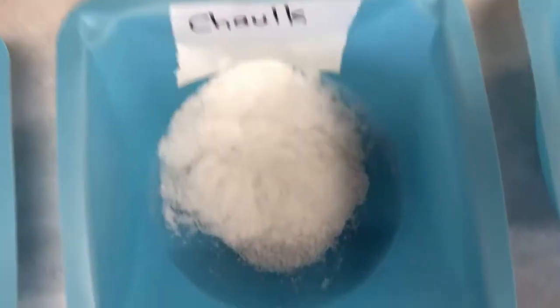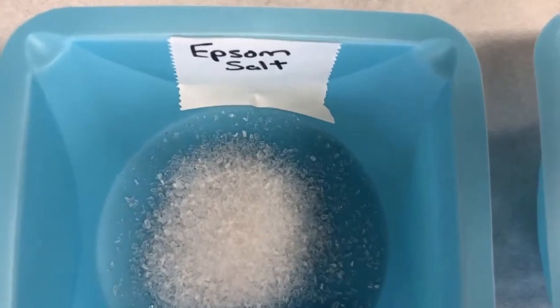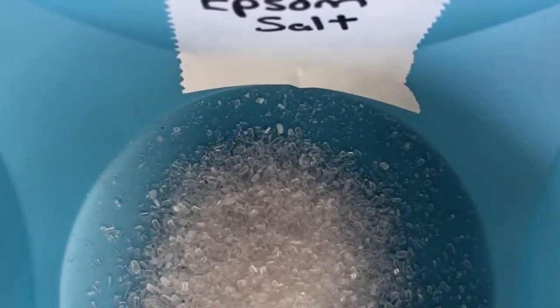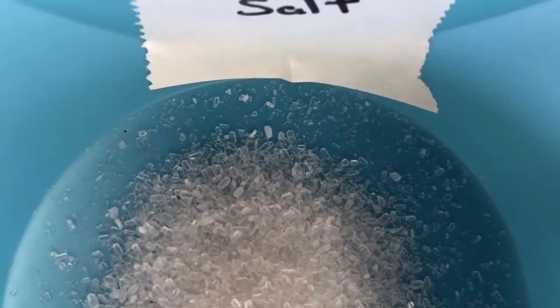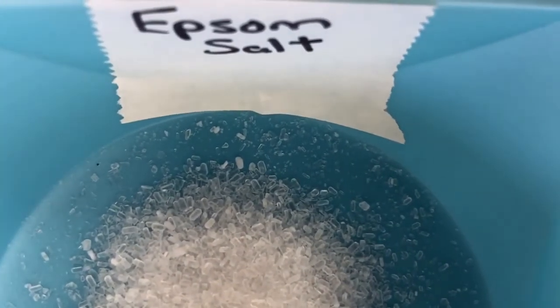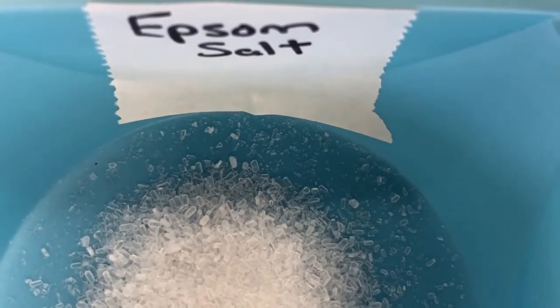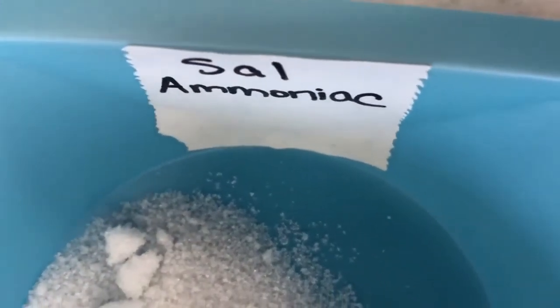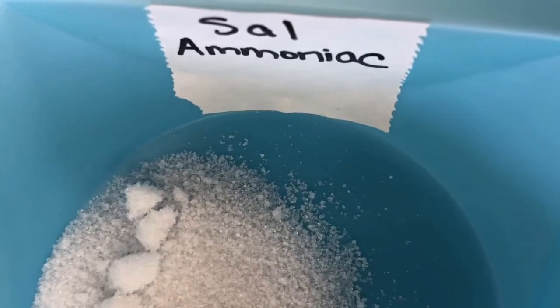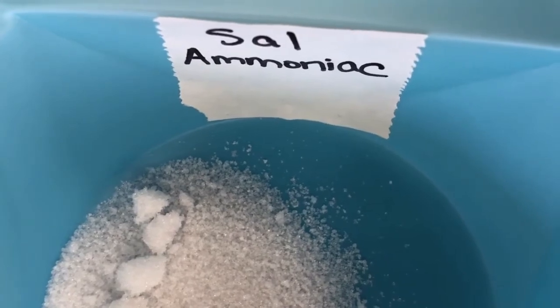I know that's probably a little hard to see in this video, but it is actually a white substance. Let's move on to our next substance, which is Epsom salts. Again, it's a crystal structure. This one is actually a little easier to see perhaps, that the individual crystals of the Epsom salts are colorless. So again, it's a crystal particle type, and it is colorless. Our fifth compound is sal ammoniac. You may not have heard of this before, but it's commonly used in cleaning compounds. It contains ammonia. If we focus in again on a crystal of sal ammoniac, you can see that it is also colorless. So it's colorless and it's a crystal particle type.